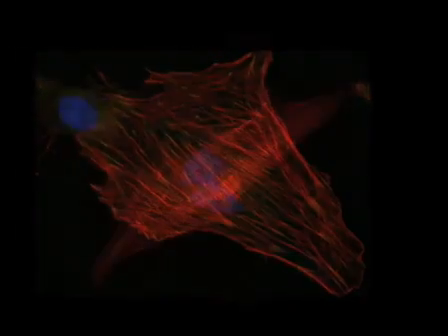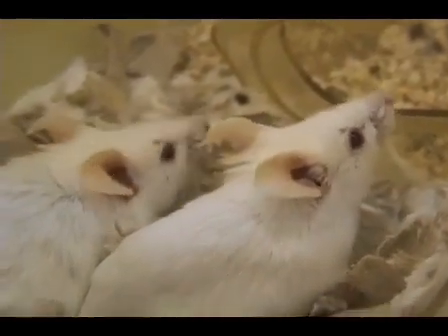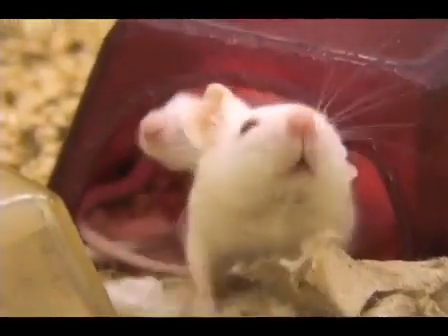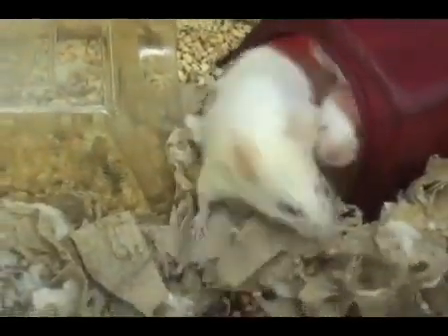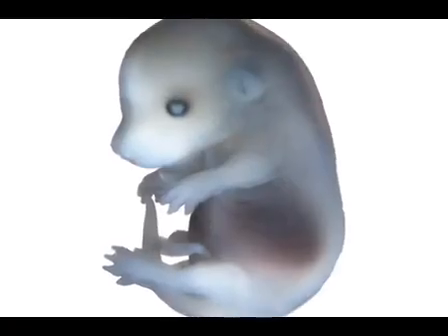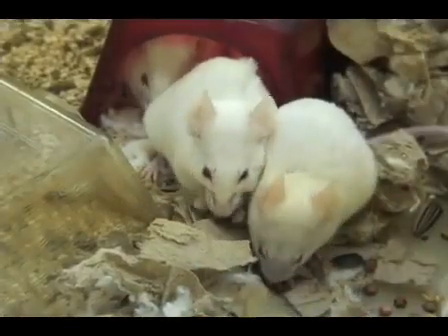Modern genetic analysis relies heavily on techniques that facilitate the targeted removal of specific genes from cells, organs, or entire organisms. These knockout experiments help to reveal the function of the gene in its cellular context. The molecular, morphological, and physiological phenotypes of the knockout all provide clues about the role of the gene products encoded by the deleted sequence.